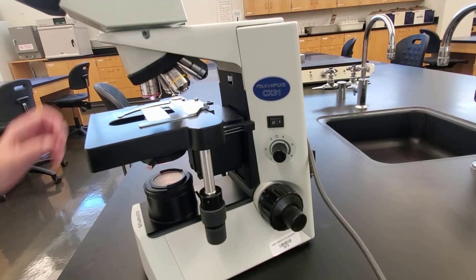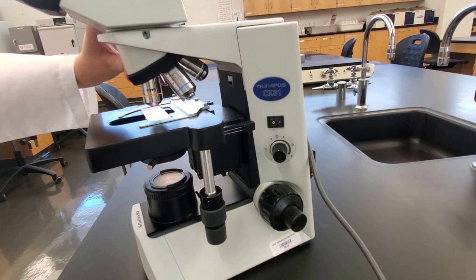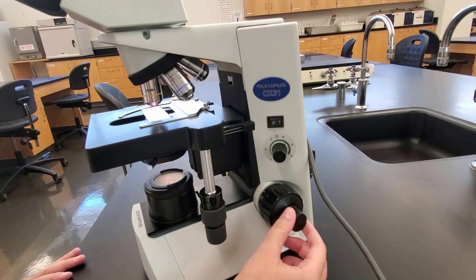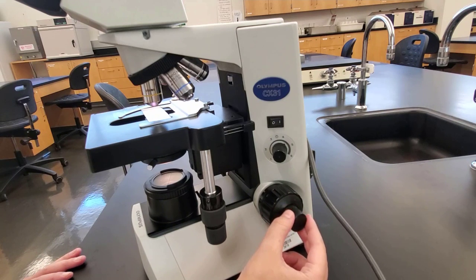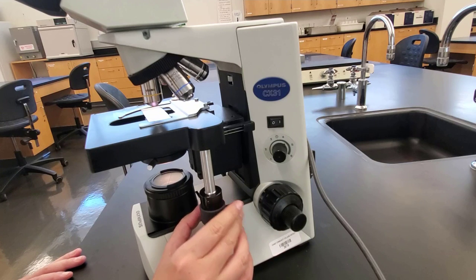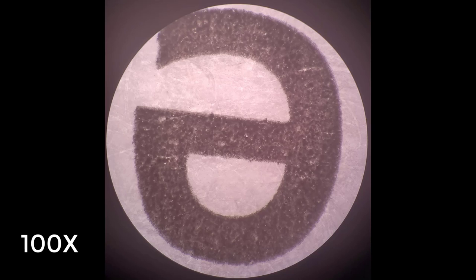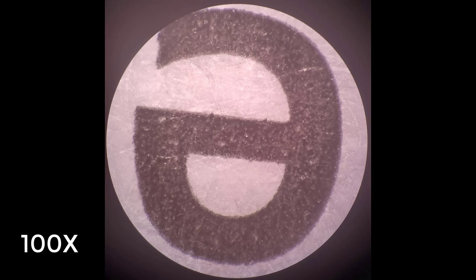Use the revolving nosepiece to rotate the 10x objective into place and snap it in. Once at a higher objective, don't use the coarse focus — it moves the stage too much. Use only the fine focus to refocus, then use the stage adjustment knobs to re-center the E in the field of view. At 100x total magnification, notice the E is much larger and occupies more of the field of view because we are more zoomed in — as magnification increases, field of view gets smaller.